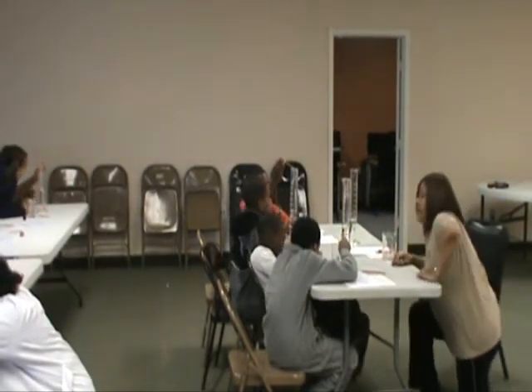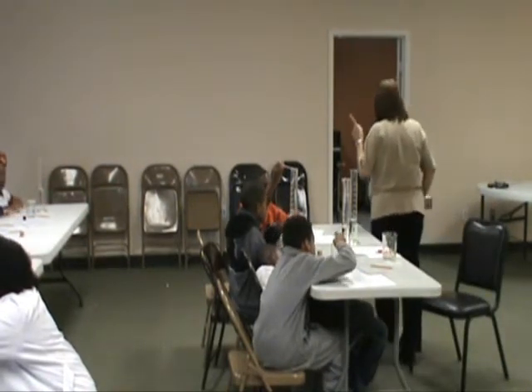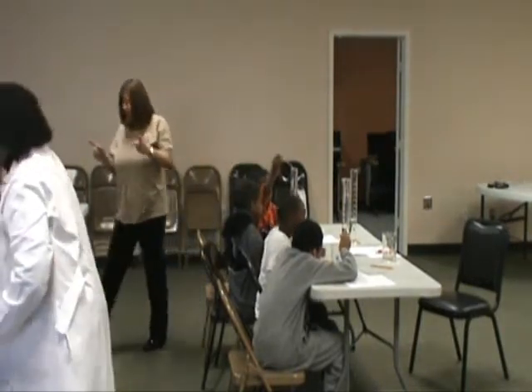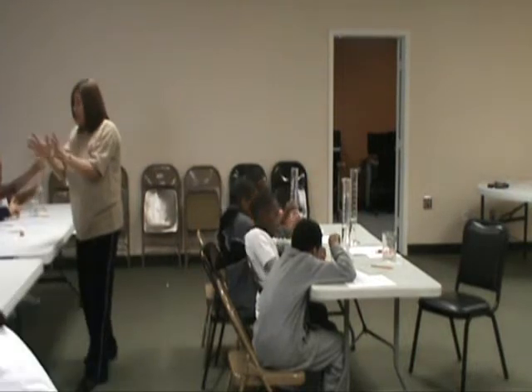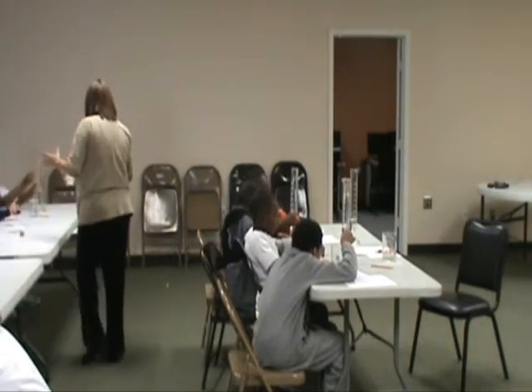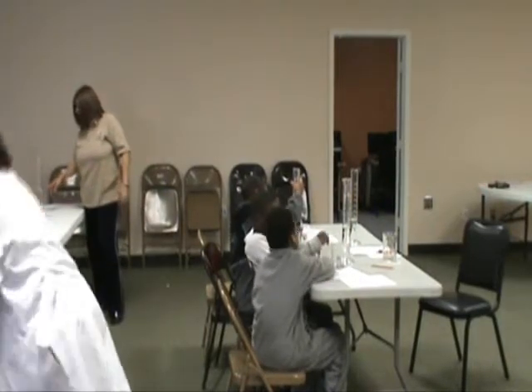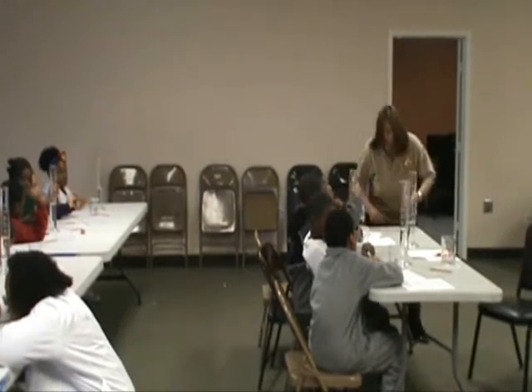Now, students, let me tell y'all a little secret. You'll know when it's perfect. How do you know it's perfect? Very accurate. It's going to shine at you like a mirror. What that shine is, is the reflection of the bottom hitting the line. That white line is going to make a beautiful mirror.